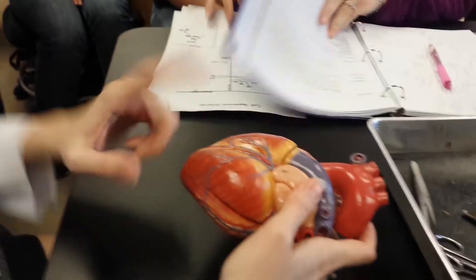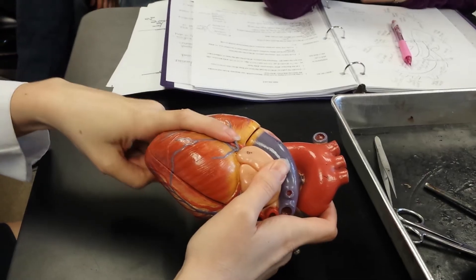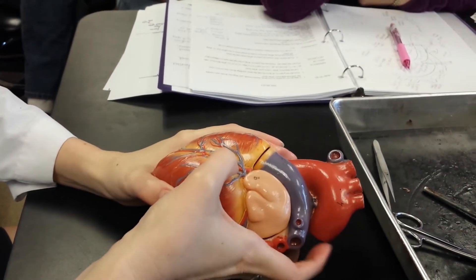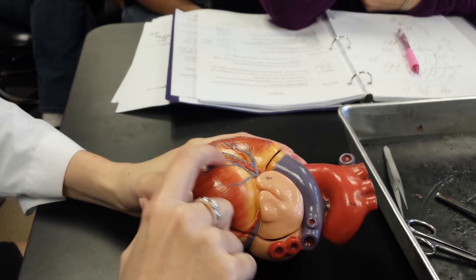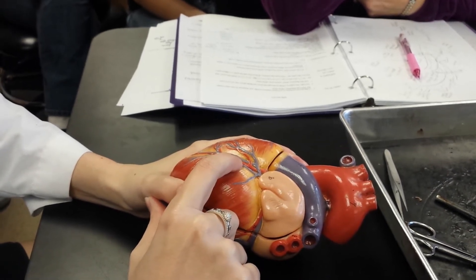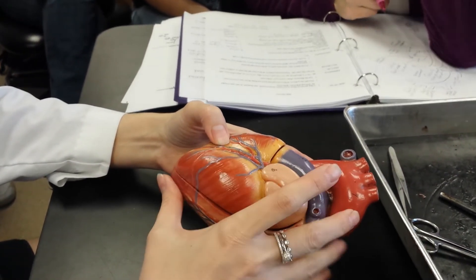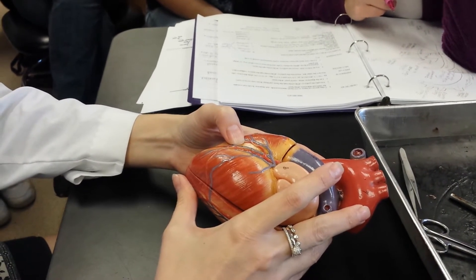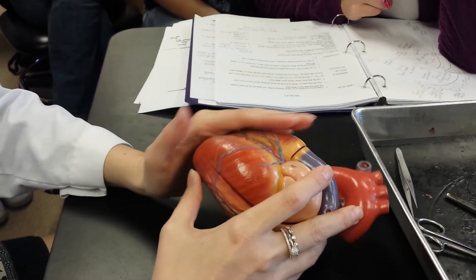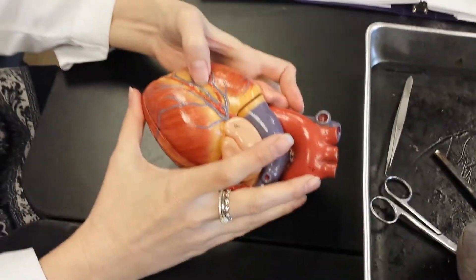So again, we have our front — this is our anterior. Here is our anterior interventricular sulcus. The red here in the sulcus is the artery — this is the anterior interventricular artery. The blue is the vein, and this is the great cardiac vein. All of these are called coronary arteries and coronary veins in a general way, but when I stick a pin in it I want the specific name — so this is the anterior interventricular artery and the great cardiac vein.